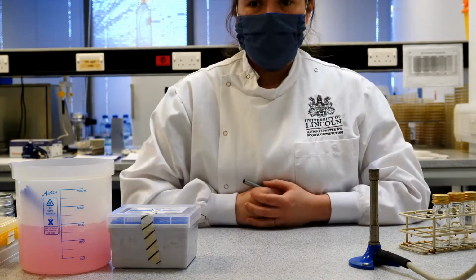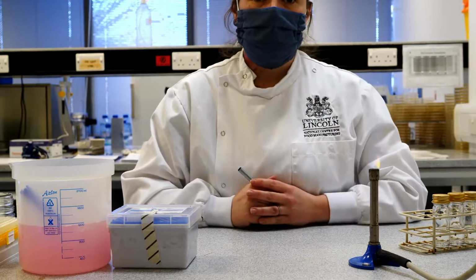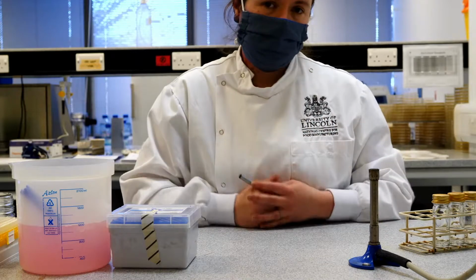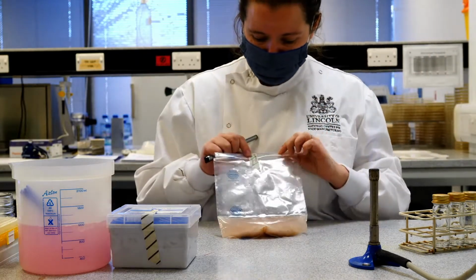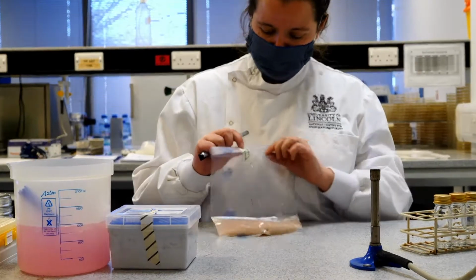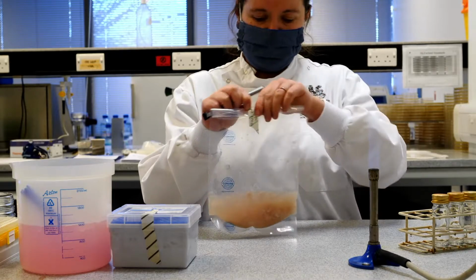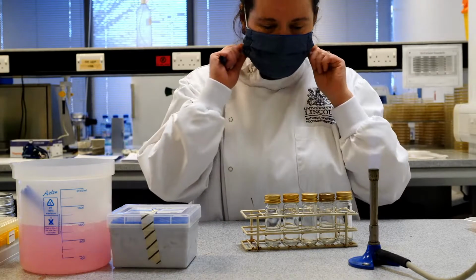One of the most important things in the microbiology lab is that everything is labelled, so we know precisely what we're doing and we can go back and find all of the bottles and solutions and everything else that we're working with. So hopefully you'll be able to see that I've already labelled up my stomached sample. I've labelled it here as sausage with my initials and the date when I set that up, which was today. Now, the first thing I'm going to do is a serial dilution.